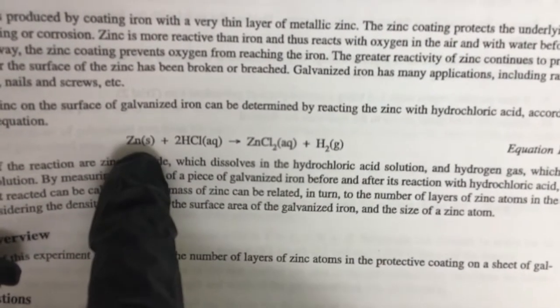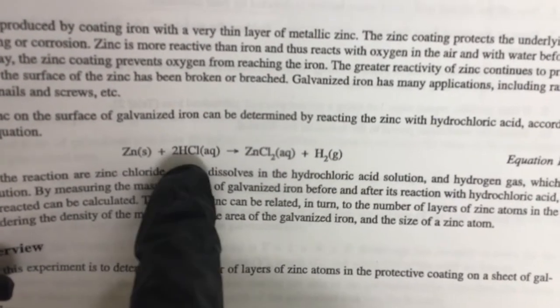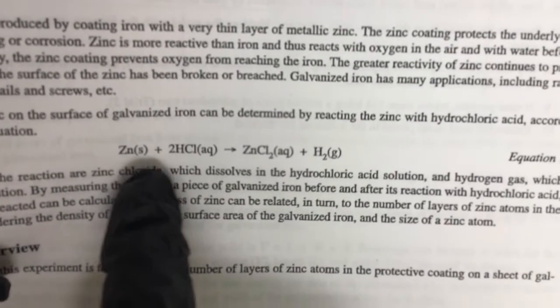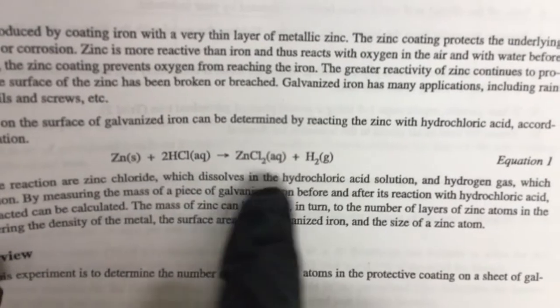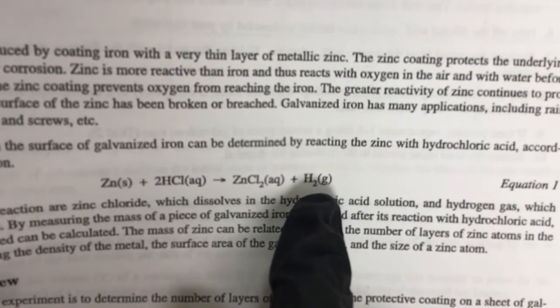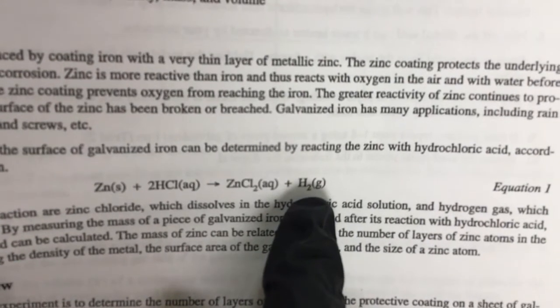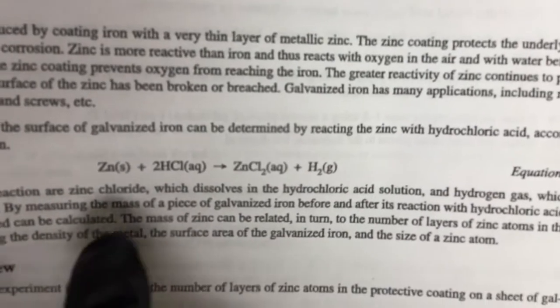Essentially what's happening here is the zinc is having its electrons ripped away from it by the hydrogen ions that are present in HCl. Those hydrogens are each going to take one electron from every zinc atom, and then those hydrogen atoms are going to combine to form that hydrogen gas. Because of this, it's super important that I am mindful of my environment, making sure there's no open flames or sparks, anything that would potentially ignite the hydrogen gas in this oxygen-rich environment that would be dangerous.